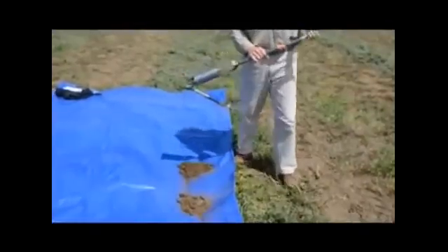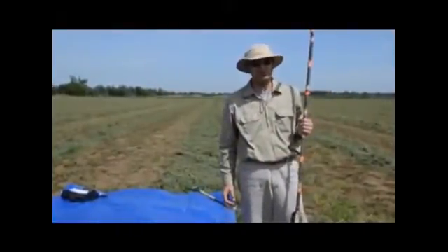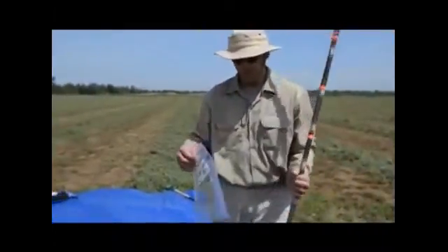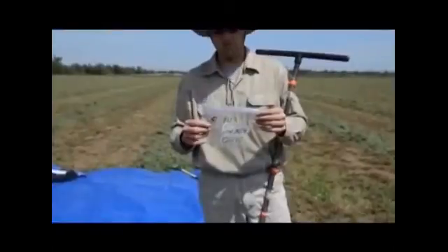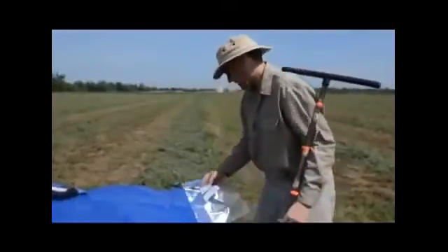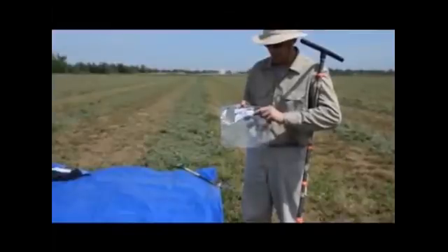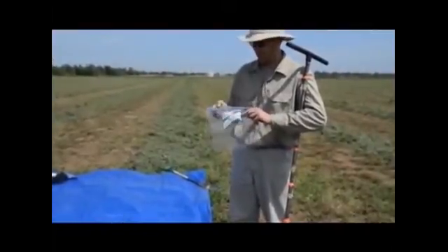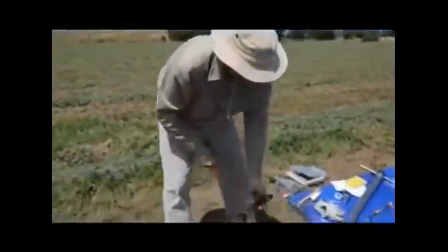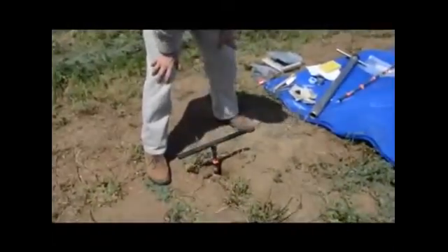And as we proceed with separating out these different piles corresponding to different sampling depths, we also prepare the bags that will contain our samples, and we place them in order so that we don't confuse the different samples. And this is for the 0 to 10 centimeter depth. We indicate the plot ID, the date, and the initials. At this point I have almost completed the 130 to 150 centimeter depth increment.